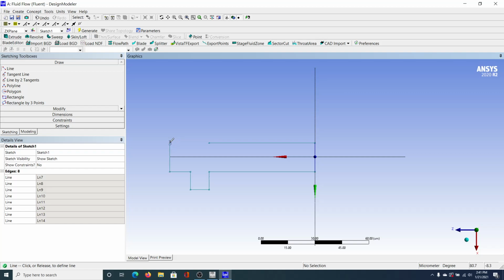And you see that little circle that just came up? When you're doing that, you should know, let me undo that to show again. So when I click here, this point, click once. And when I go up and this little arrow almost points up here, the tip of this little pin symbol, you can see that because there's almost like a little half circle around it. See, now it's there, now it's not. And you can also see that little symbol, looks like an A on the Z-axis. You want both of those to come up, and that lets you know that the line's parallel and it's basically going to intersect the line to the right. That way these lines will be matched up.